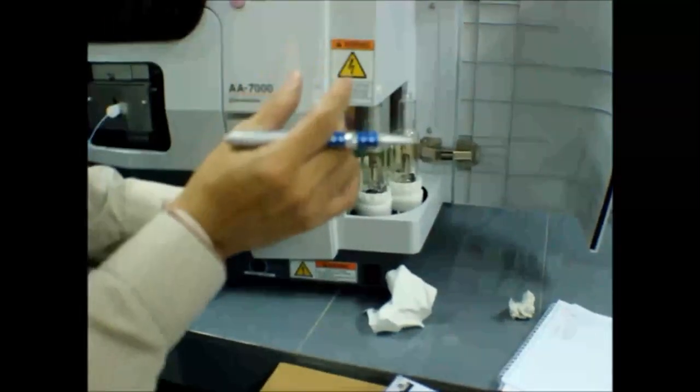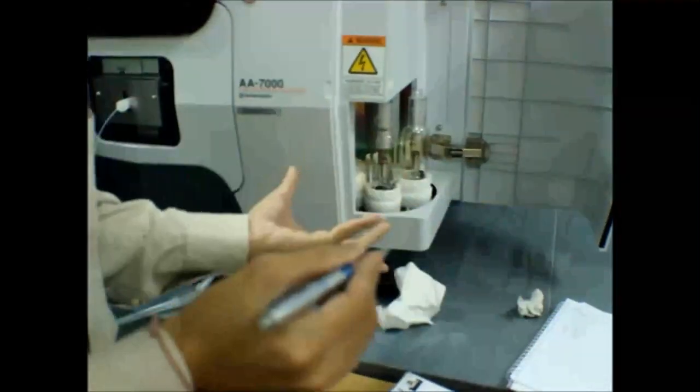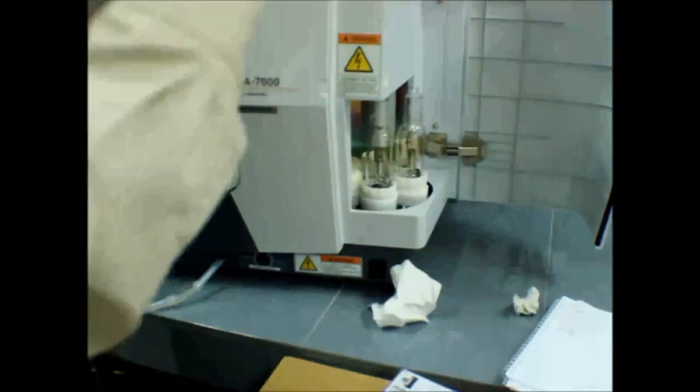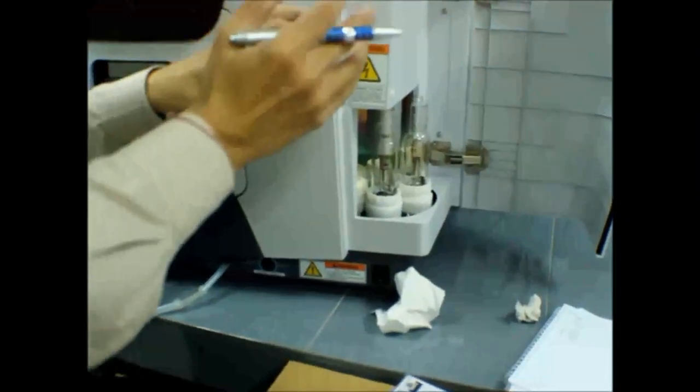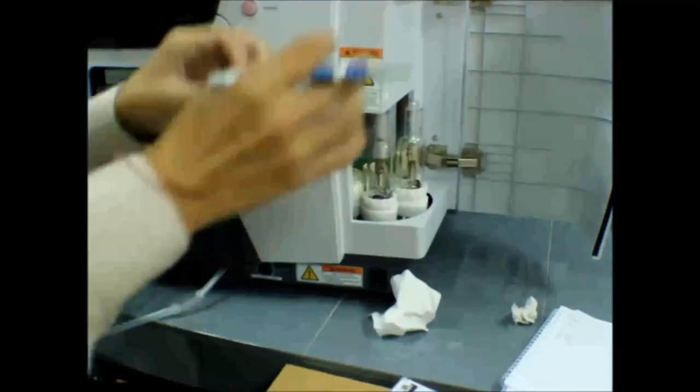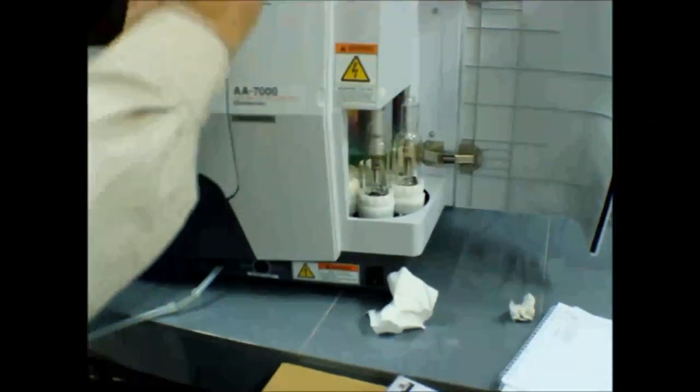Sometimes, let's say I already put 6, but now I want to use potassium. Oh, no potassium lamp. Then you need to take out another lamp. So you better put the most frequent element you want to analyze. Don't put seldom one. Seldom better don't put first.